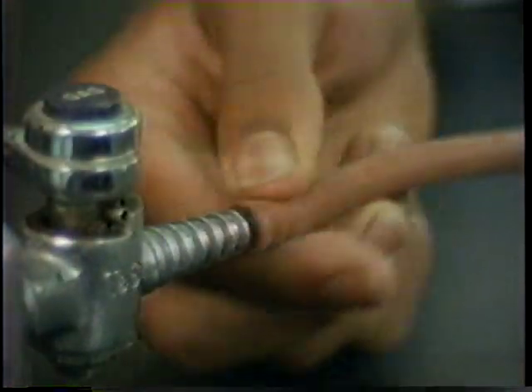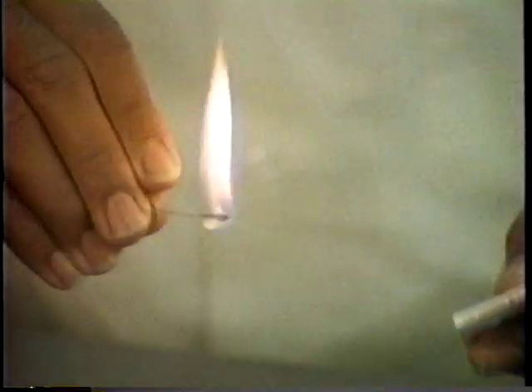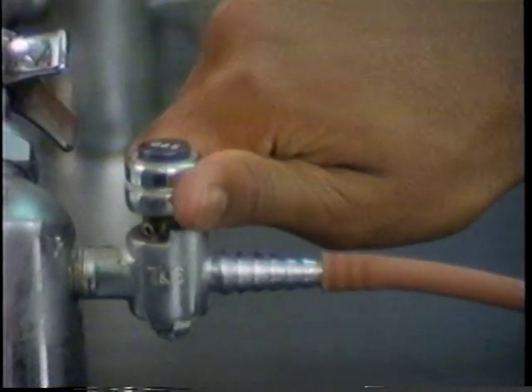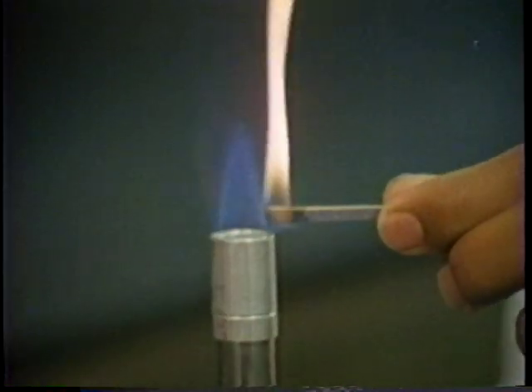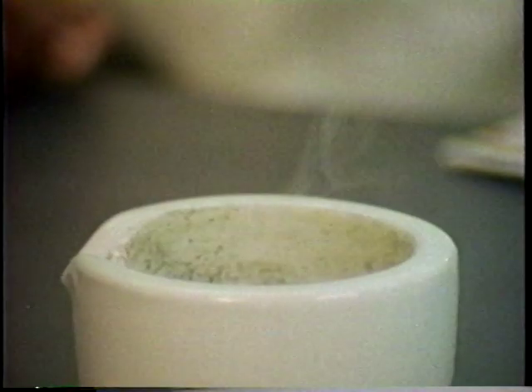Go on. Well, the first thing I did was to make sure that the burner hose was properly connected to the gas jet and not the compressed air outlet. Then I lit the match first, and then turned the burner on. You gotta remember to light the match first, otherwise gas could build up in the air. Then I made sure to throw the match into the right container and not the wastebasket. What would you do if there were some volatile materials around, like alcohol or ether? Well, I make sure there's none of that around before I light the burner.